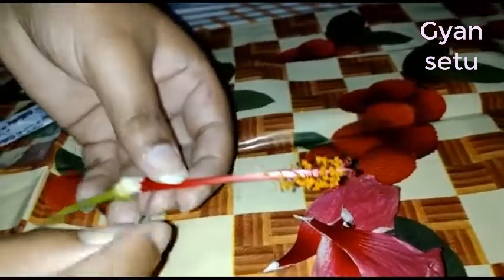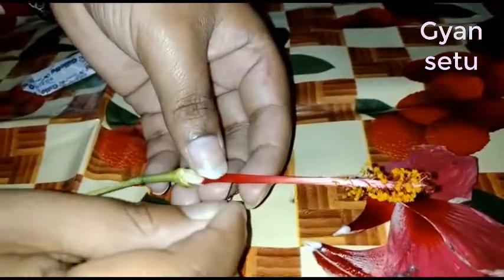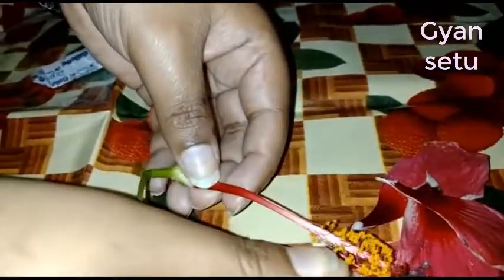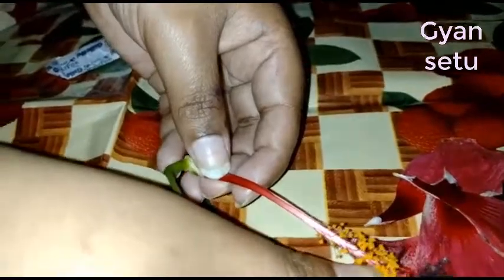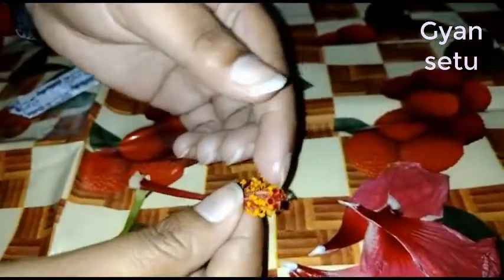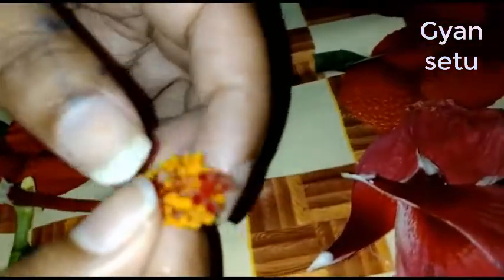I will just take a needle here to make a separate cut. This is your pollen grains — pollen grains generally attract insects for pollination.